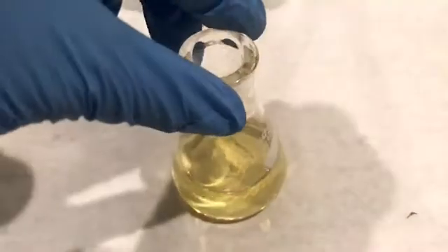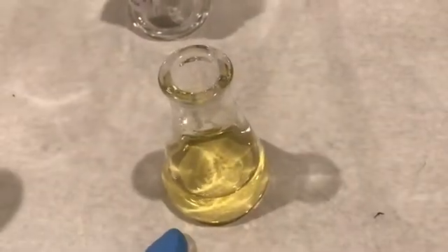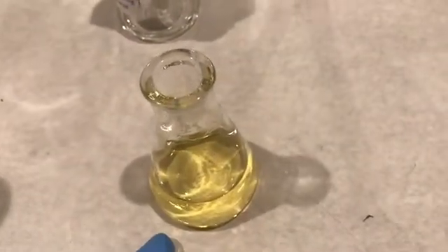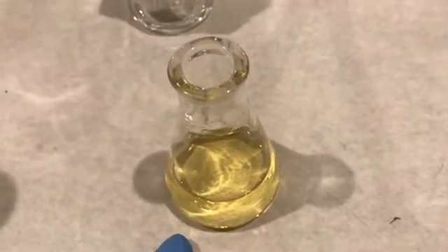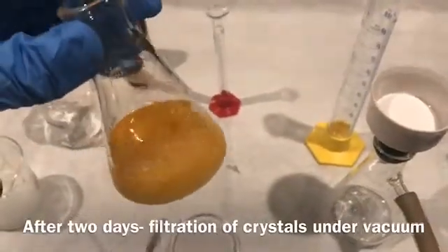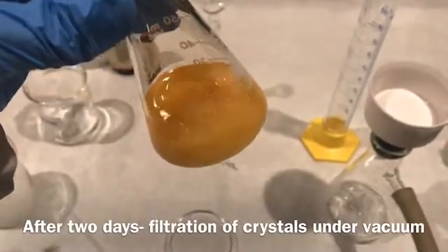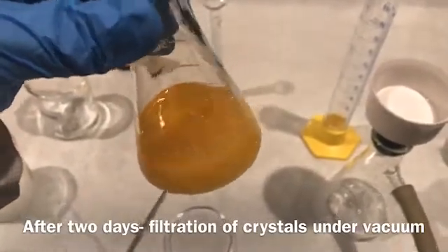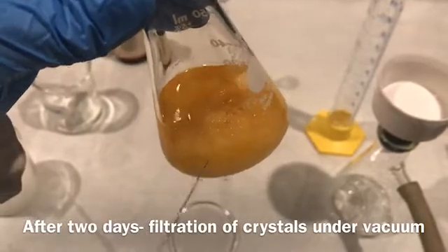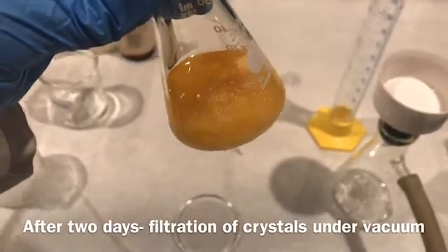Now I am going to stopper this flask and put it in the dark for two days, then I will observe it and record the observations. After two days, the flask has a good amount of crystals, so I do not have to scratch the glass with a glass rod to initiate crystallization.